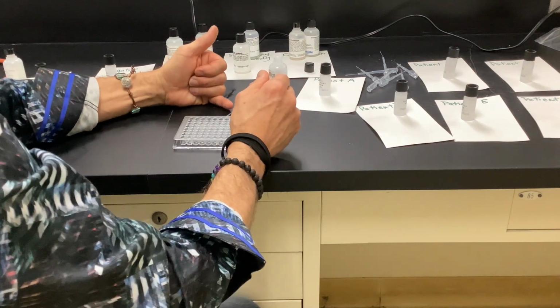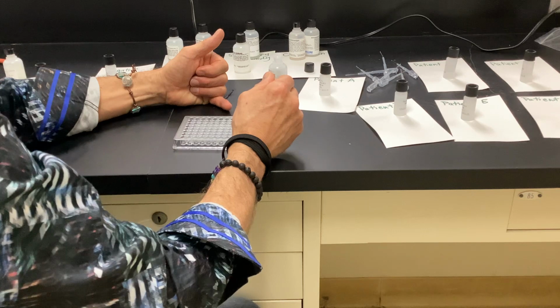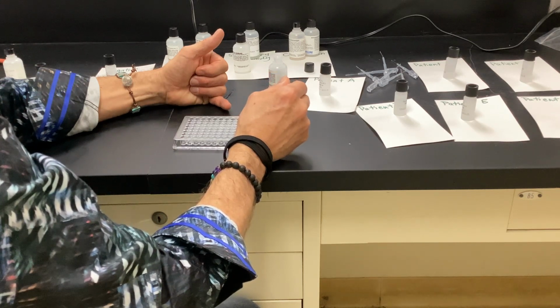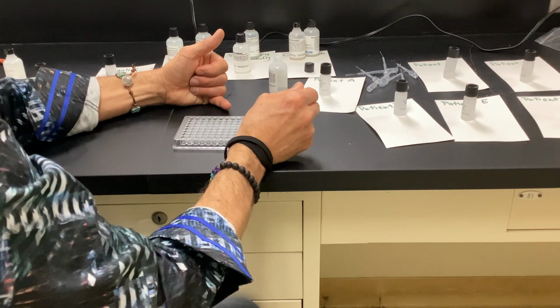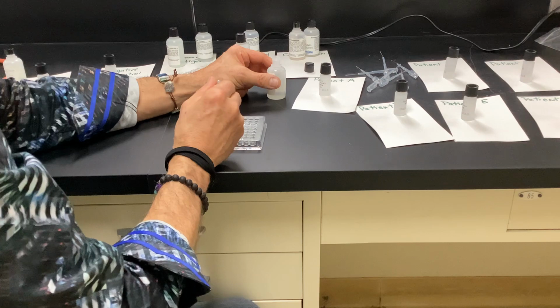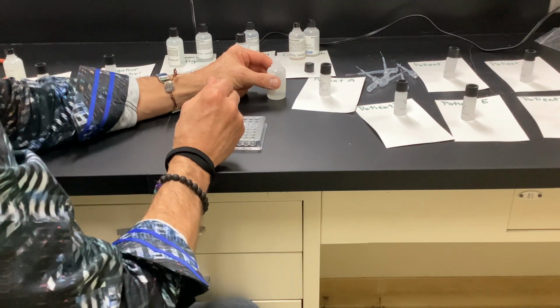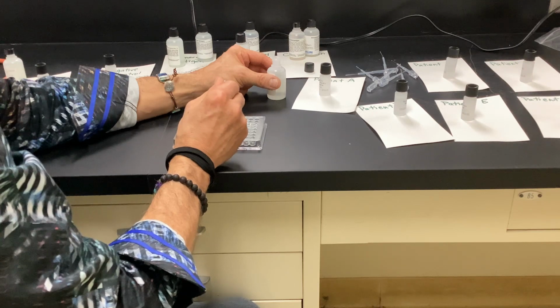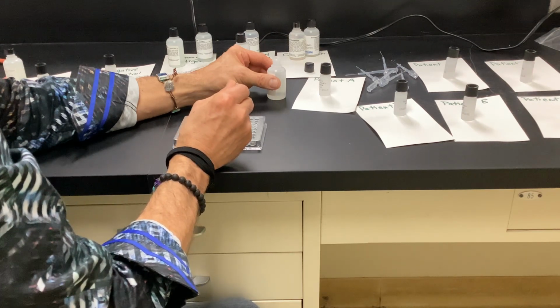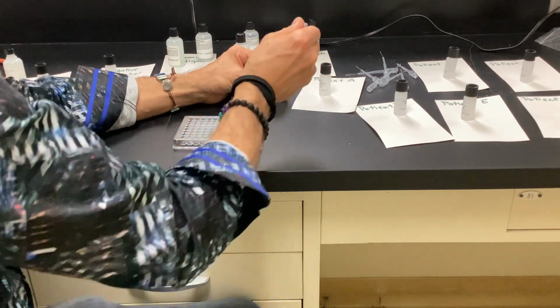And now I'm going into patient A. This is patient B. Should be patient C. And how many am I doing for each patient? 3. Why? Triple check. Because if it was 1 or 2, you could get a false positive or a false negative.